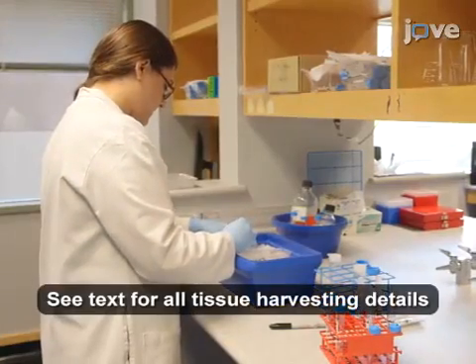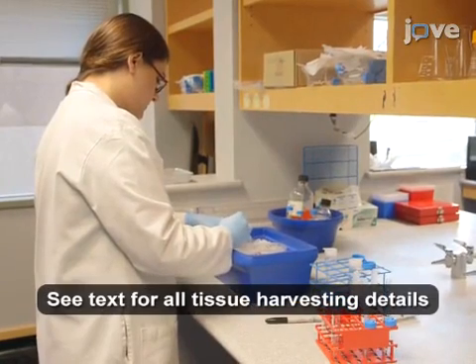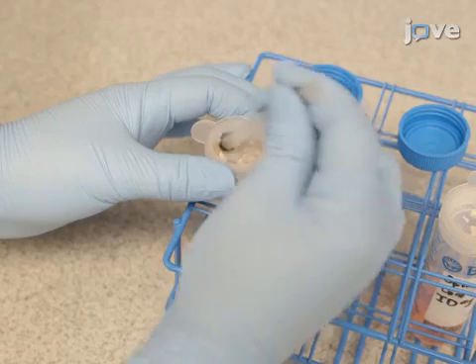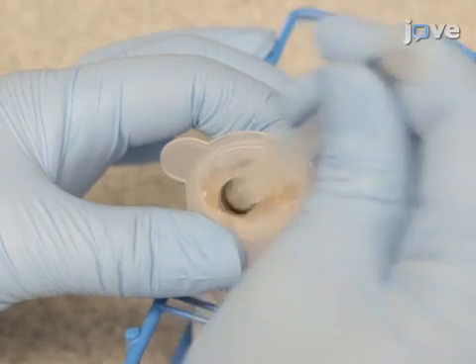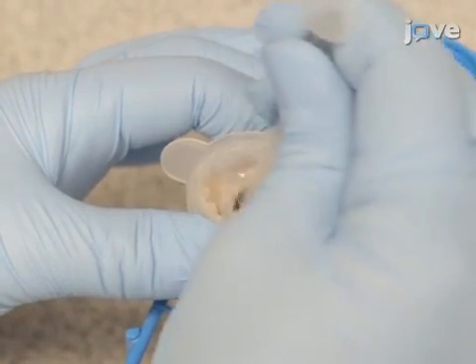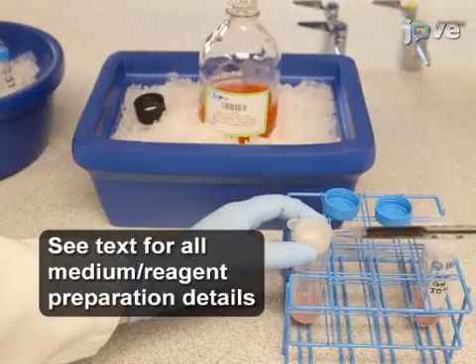Begin by using sterile scissors to mince the brains and spinal cords from individual animals into small pieces. Then use one 3 ml syringe plunger per tissue to mash each sample over individual 70-micron cell strainers into individual 50 ml conical tubes while rinsing the strainers with medium.